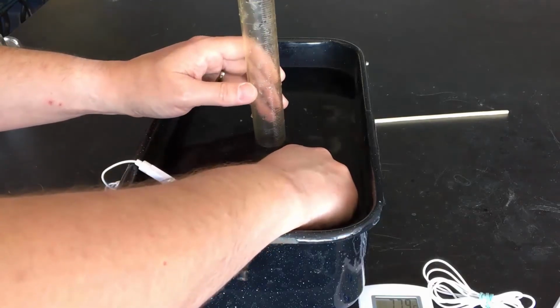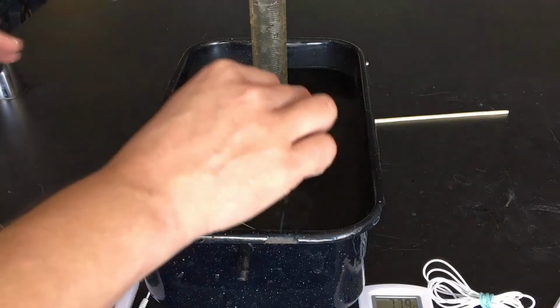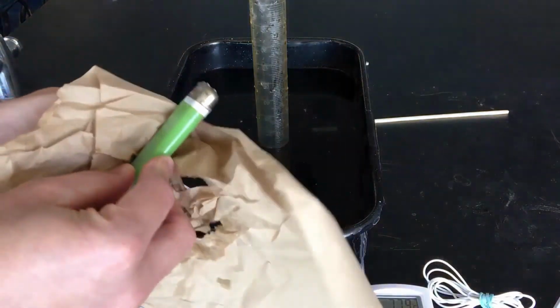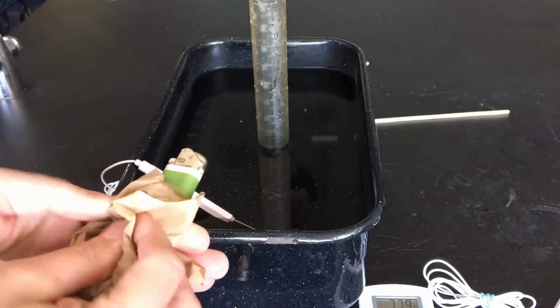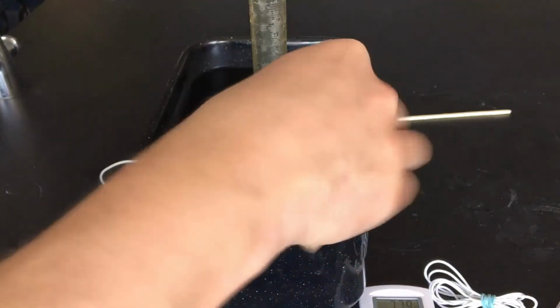Make sure no gas bubbles are trapped inside of the lighter chamber that could slide off to the side, pop out, and not get captured by the graduated cylinder. And then we're going to dry it off the same way that we did at the beginning. So we want to do that in the same manner. We can then take it to the scale and get the new mass.